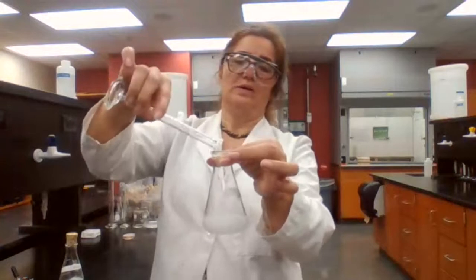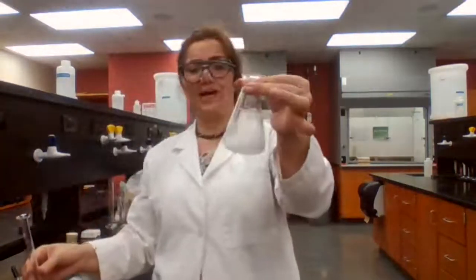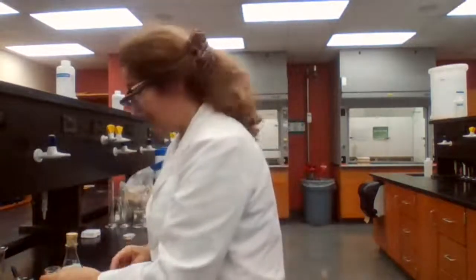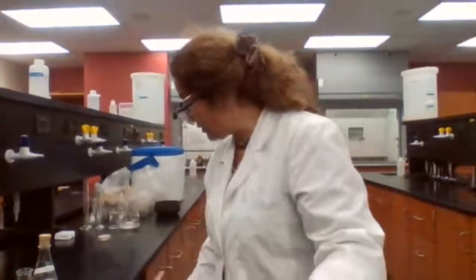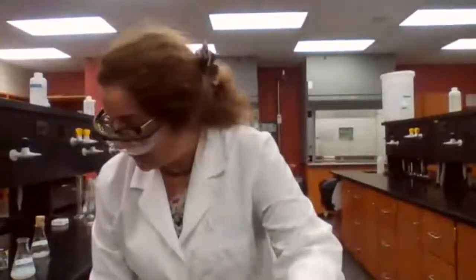So your solution must be acidic because we have a powder here, but to make sure that it is acidic, we should test for the pH.